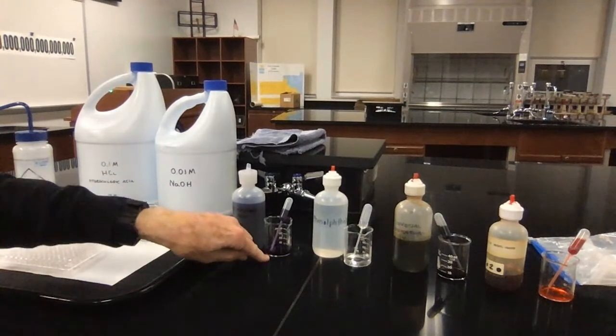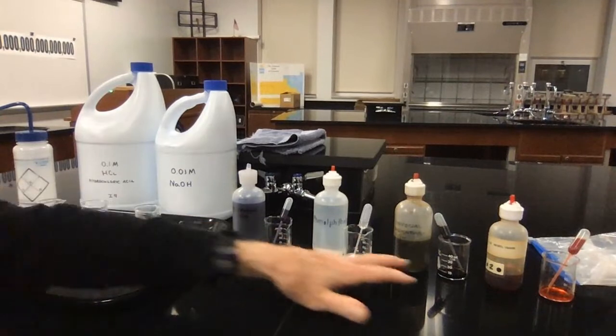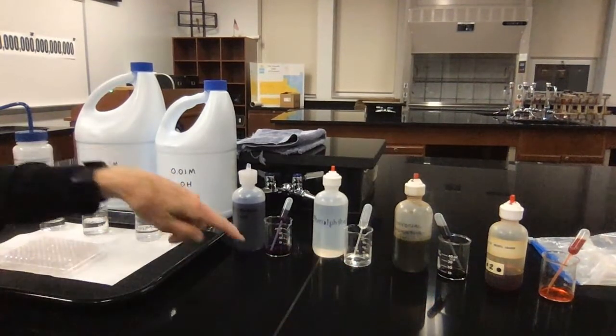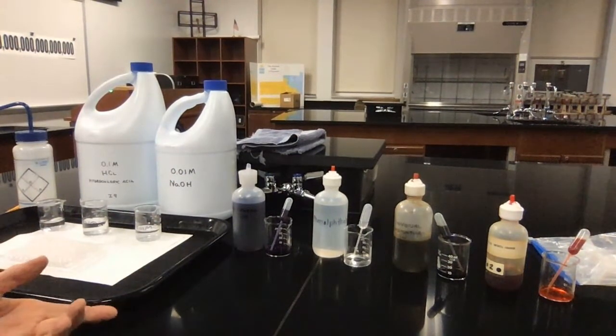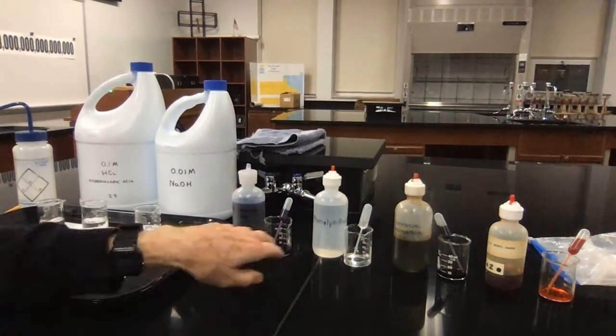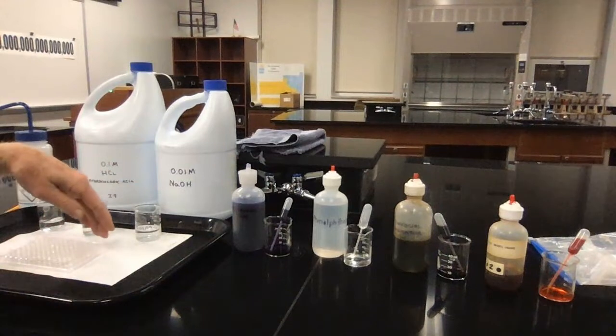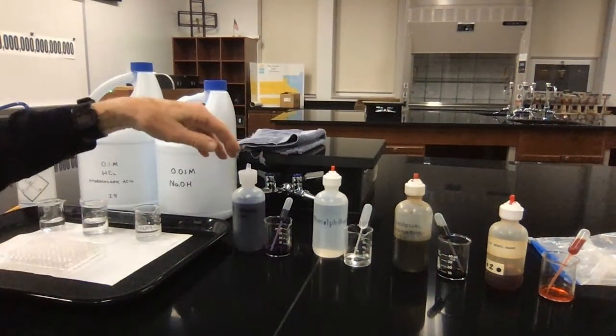Each beaker contains that dye or that indicator, and they have various colors to them. And I have a barrel pipette in each one, and the barrel pipette has the dye in it. What I want to do next is take the barrel pipette and put a single drop of the dye in the wells across row A. I'll use that for the bromphenol blue.